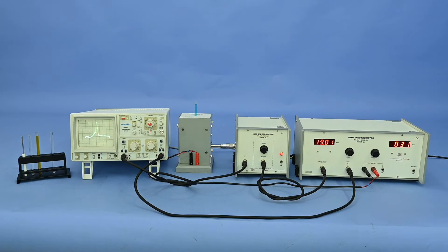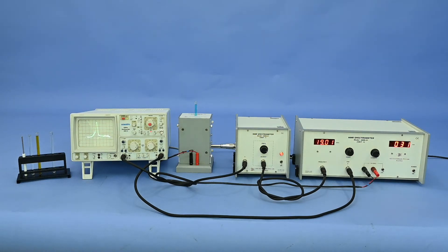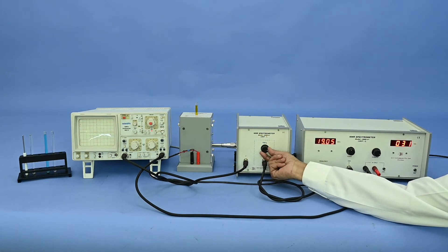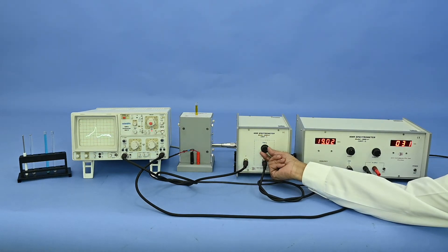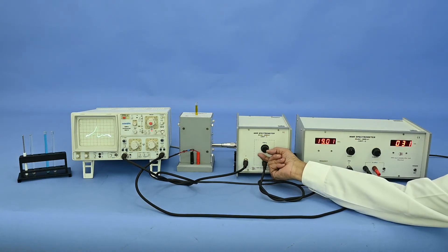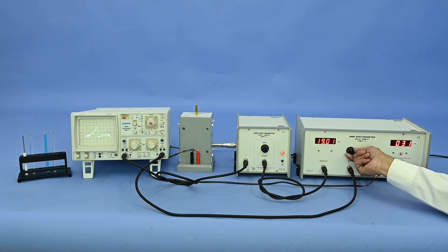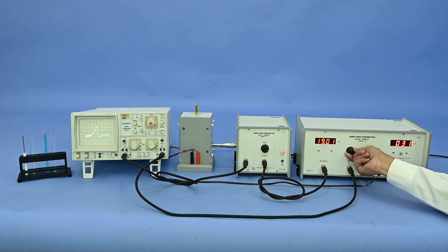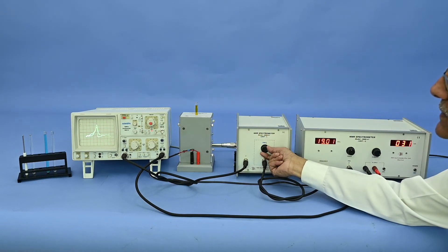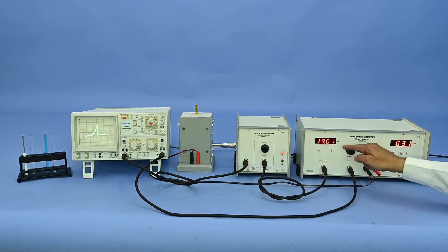Similarly, we can replace with different samples and measure the resonance frequency. The same process repeats for the FeCl3 sample. We get 2 peaks, adjust the phase and keep it at the center. This gives the resonance frequency for FeCl3.